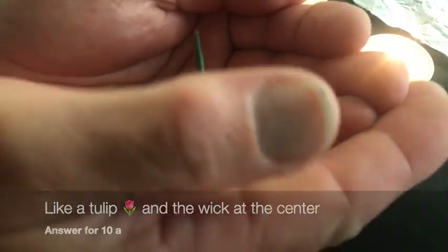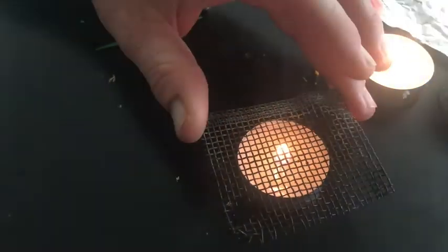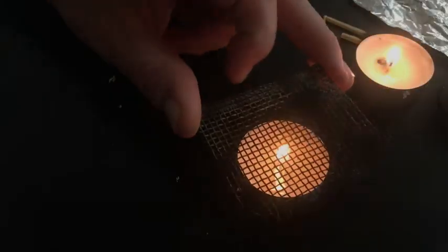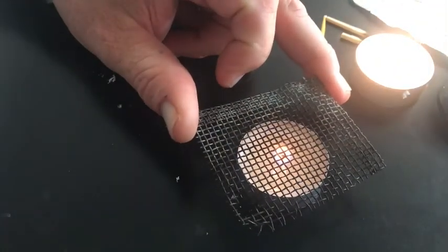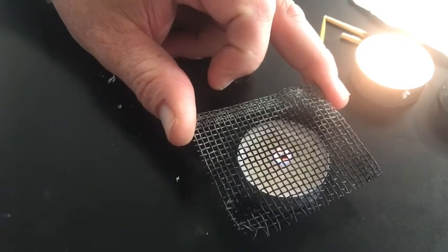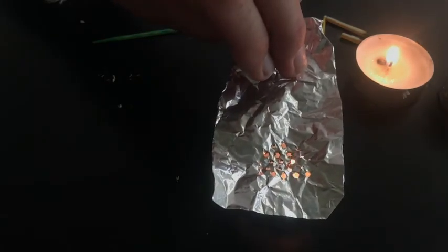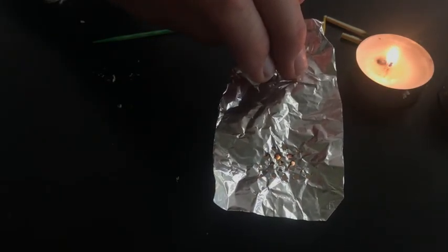The flame is round. So I don't have a top of flame that I see here. So I bring it down, and again, it's hard to see. But I've created a circle around my wick, and around that wick is the flame. So you can try your screen and see if you see the same circle again, which I do. It's just harder to see through that screen.